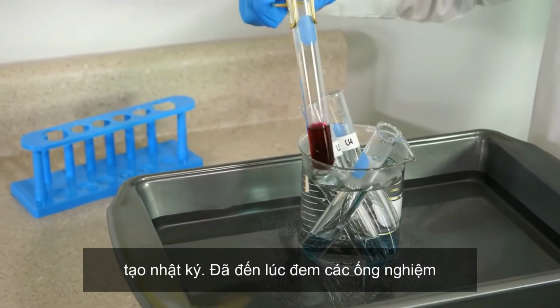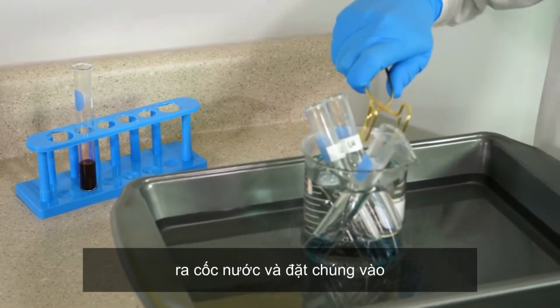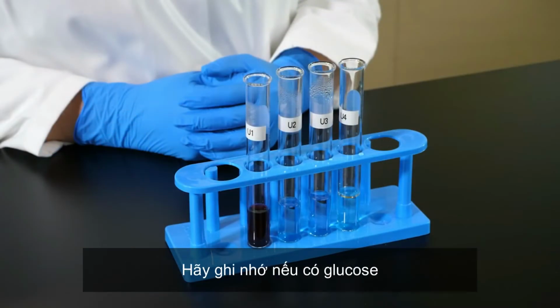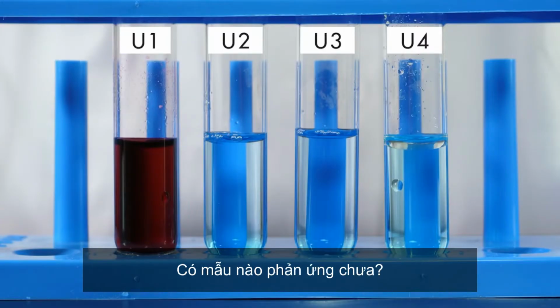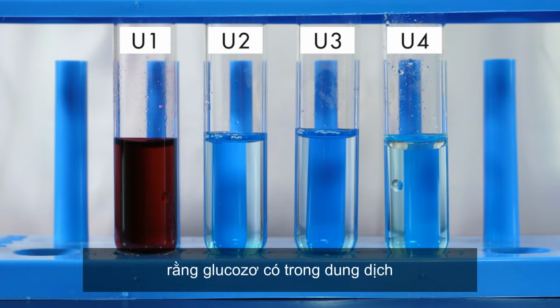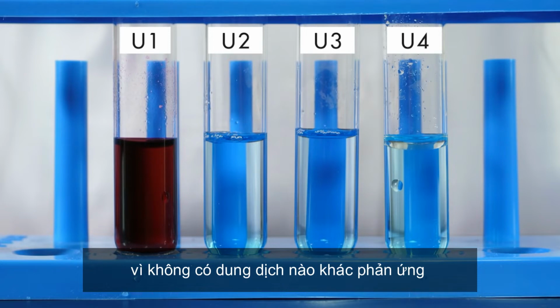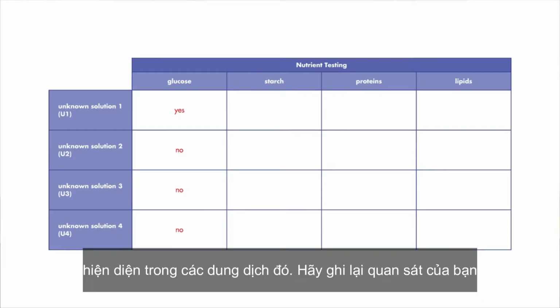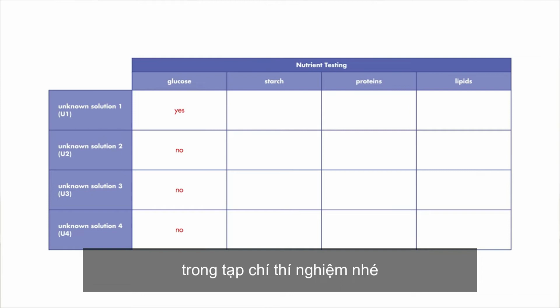It is time to remove the test tubes from the water bath and place them in this test tube rack. Let's examine the results. Remember, if glucose is present, the solution will turn red. Did any of the samples react? We see that unknown solution 1 turned red, which indicates that glucose is present in the solution. Since none of the other solutions reacted, we know that glucose is not present in those solutions. Record your observations in your lab journal.